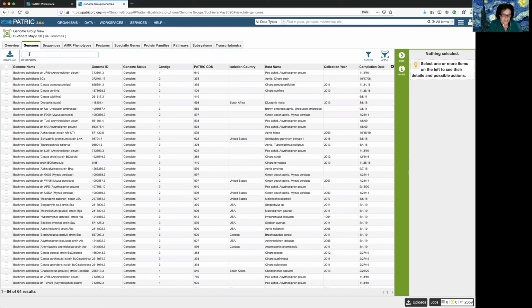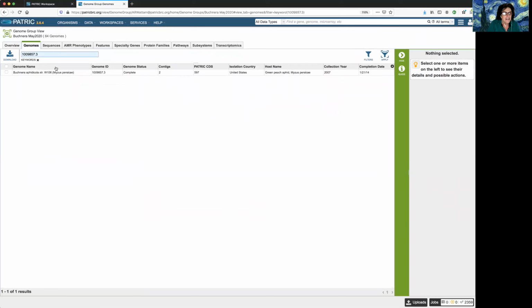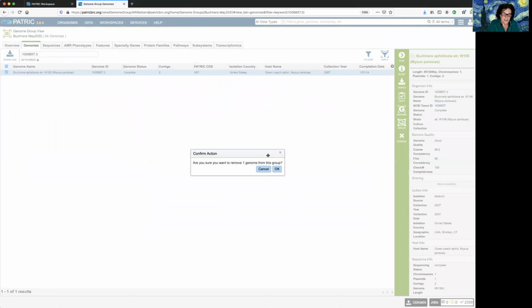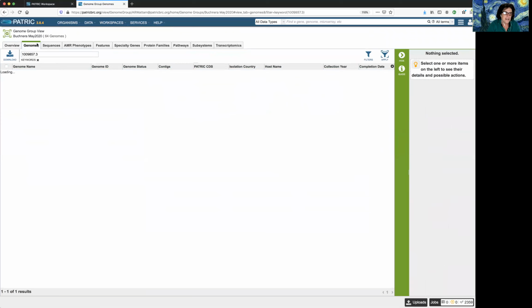So let me go into the genomes tab, and we already know how to do this, right? We cut and paste the number there and hit return. And then this time it gives me an exact match, and I'm going to get rid of that. So I hit the remove. It says, are you sure you want to remove this? Yes, I am sure. It's gone. And to verify, I click this.